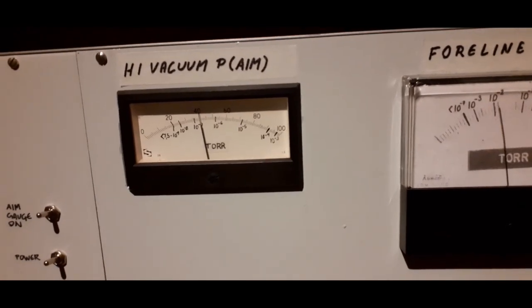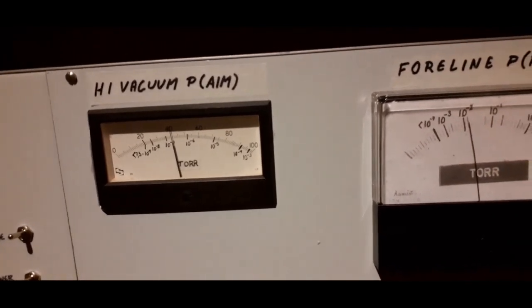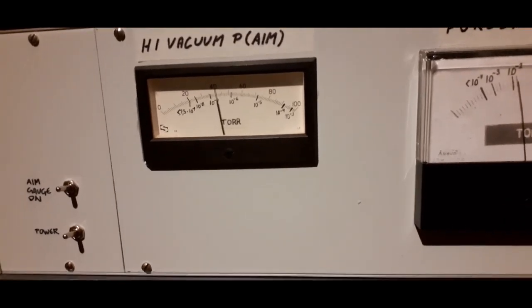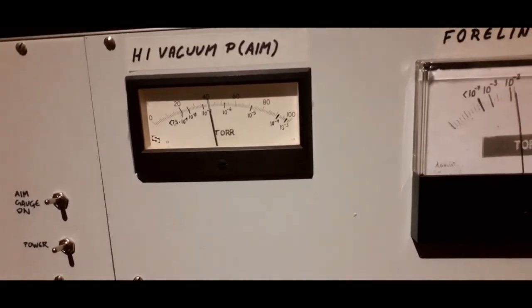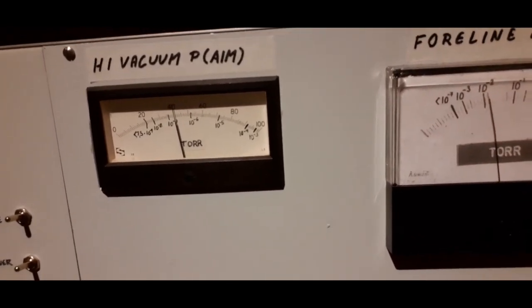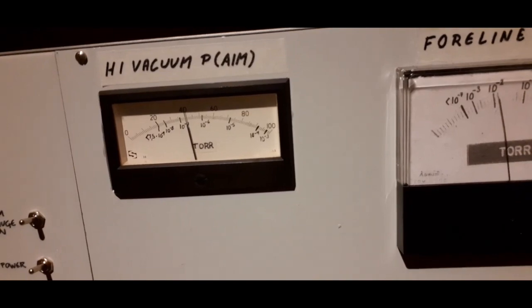So in order to reach really, really good vacuums, like 10 to the minus 8th, would require letting this run for a day or so. But this is pretty typical for a small vacuum vessel like a mass spectrometer after a few hours. So I'm not worried about that at all.